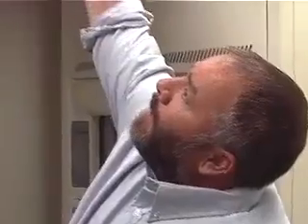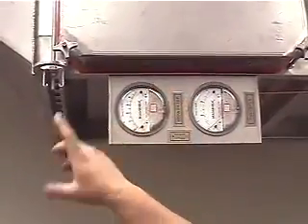Okay, so here's our bag-in, bag-out filter housing. This will be your main HEPA filter. This will be your pre-filter. We've got gauges on each. If you've got to change it, make sure you valve it off. You've got an inlet valve, and a valve on each side of it, to make sure we valve it off so nothing's going to get out.